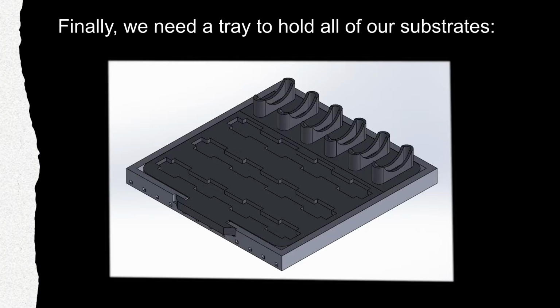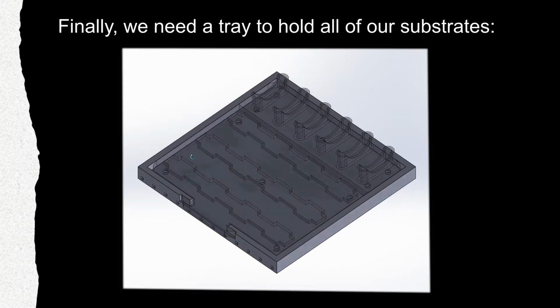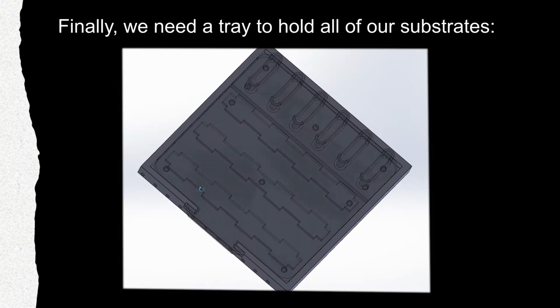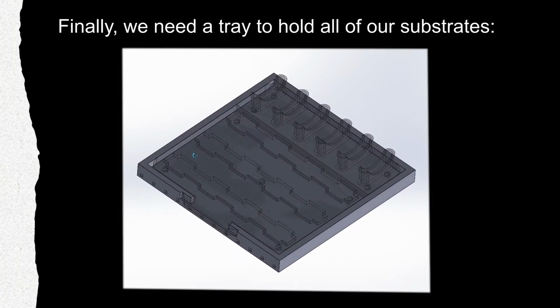Finally, we need a tray to hold all of our substrates. After some iteration, we landed on this design. The substrates are arranged on a grid on the tray, with wipes held vertically in these slots. Underneath the tray are magnets that help it clip to a holder that's been mounted to the bottom of the 3D printer. The holder is fixed, while the tray can be easily unloaded and loaded.